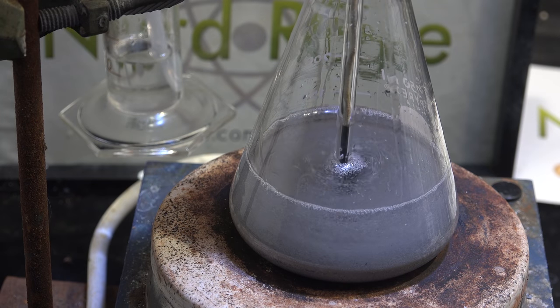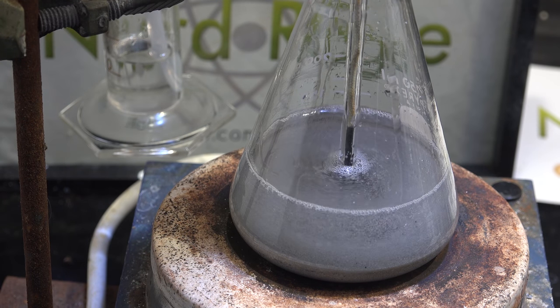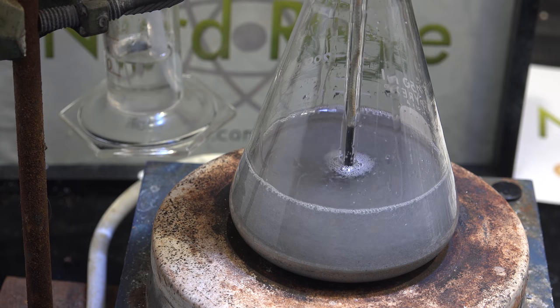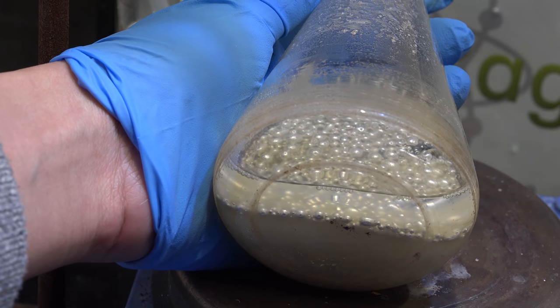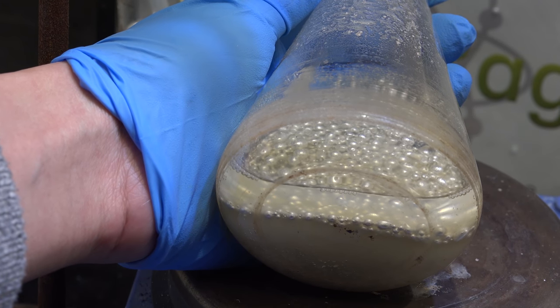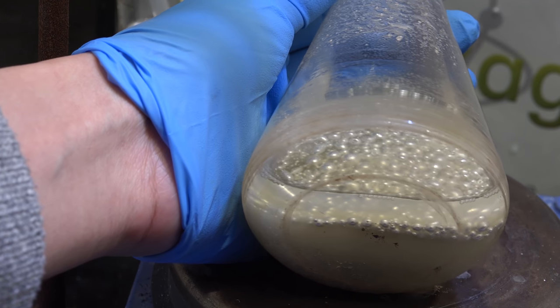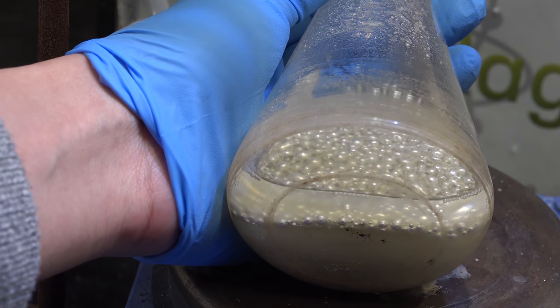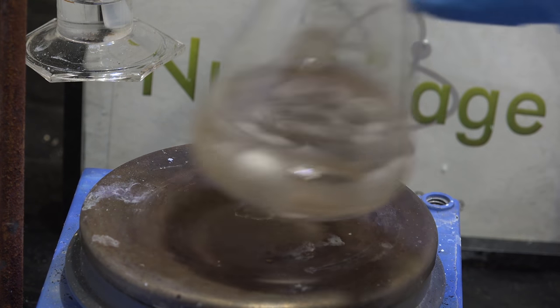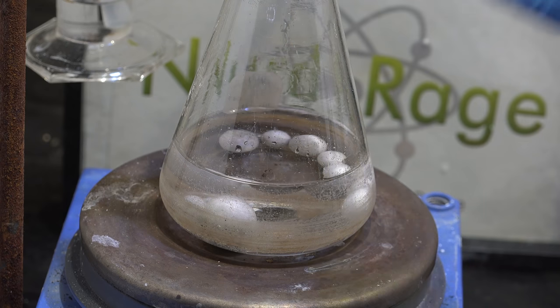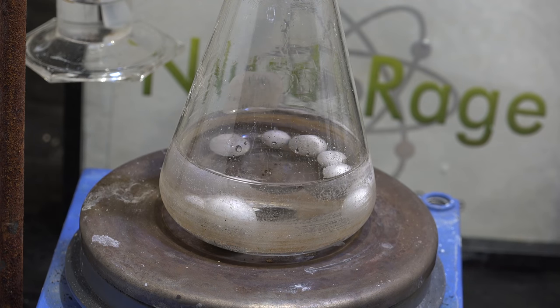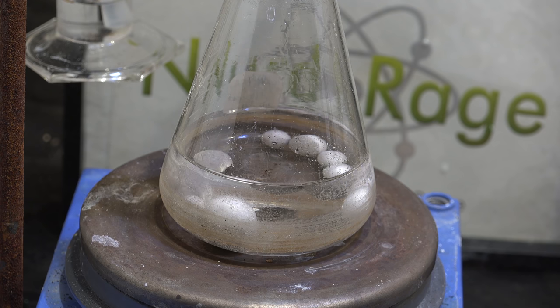In this video I want to focus on finding an alternate way to dry the sodium hydroxide or jumpstart the reaction. Using sodium metal is the best way since sodium just adds to our yield and doesn't contaminate our process or create additional waste. After we get an initial jumpstart quantity of sodium and use it to make more sodium, we can just continually feed forward into subsequent runs. But we still had the problem of getting the initial charge of sodium.